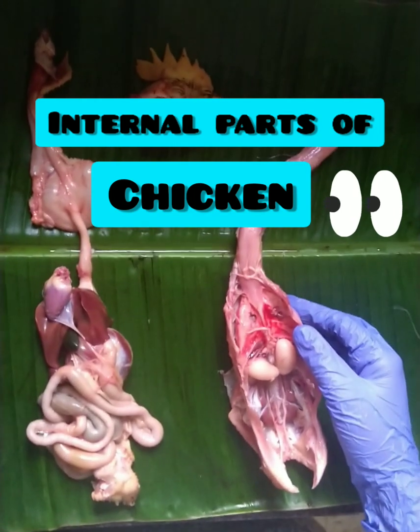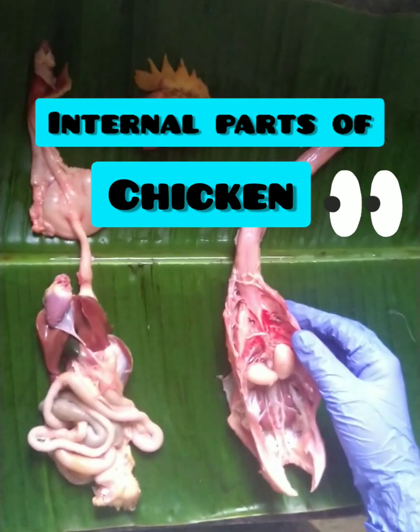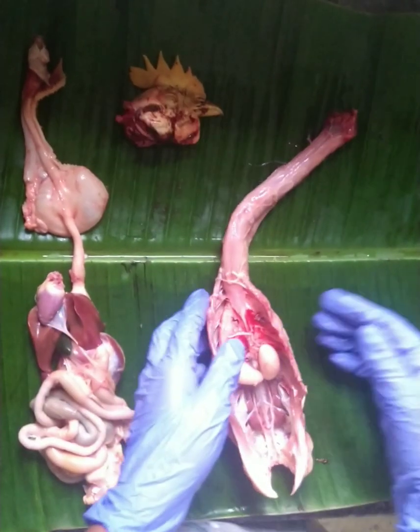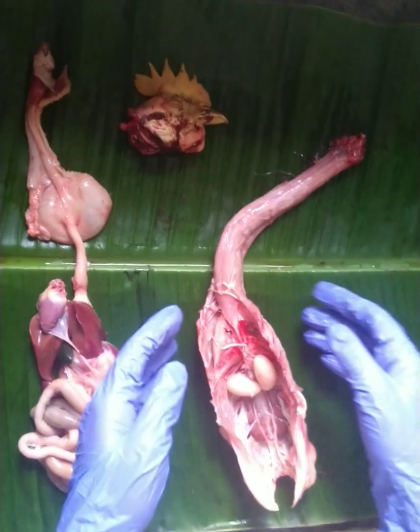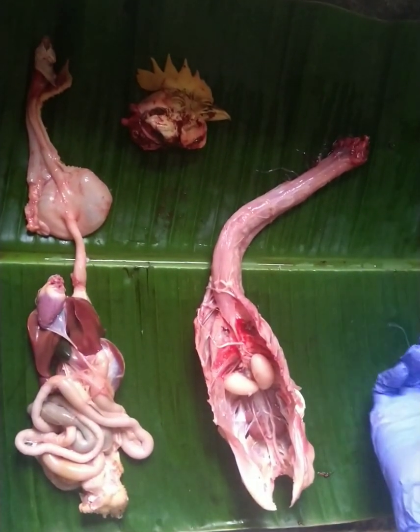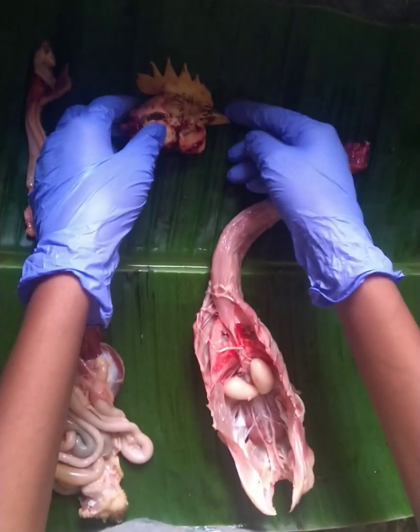Today we will be looking into the internal parts of the chicken and will try to complete most of the parts. First, I would like to show you the respiratory system.